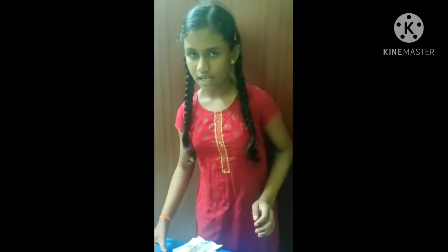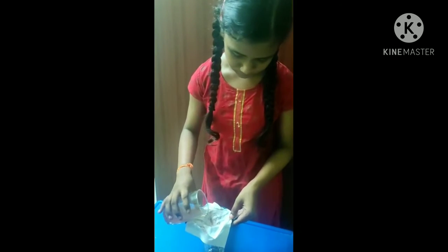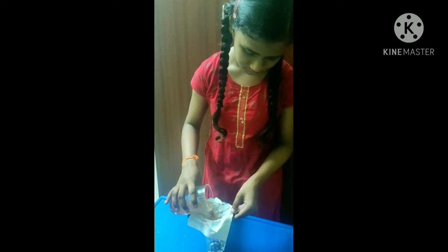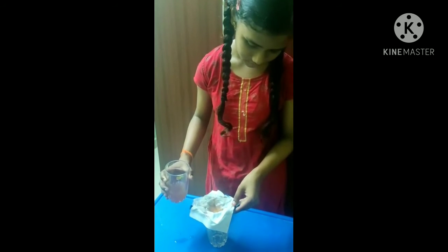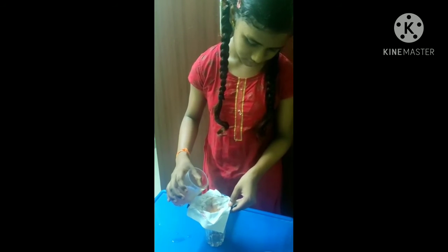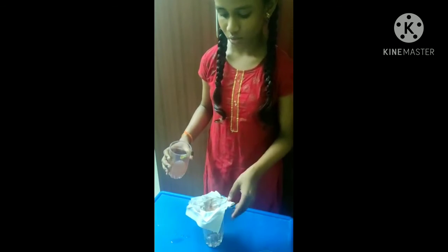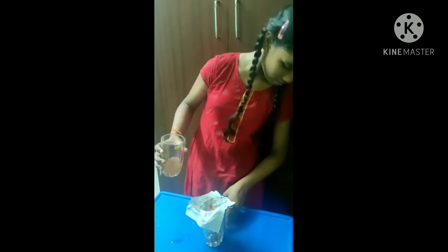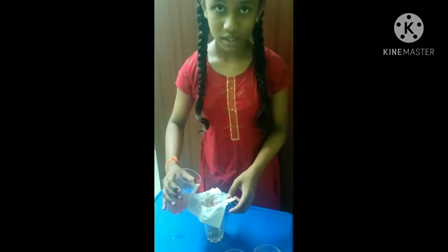Let's go and filter this water. I have used a filter paper to filter this. We are getting clear water out of the muddy water.